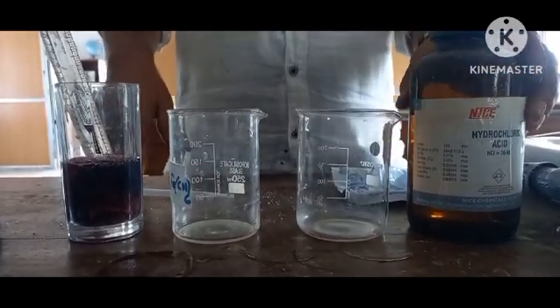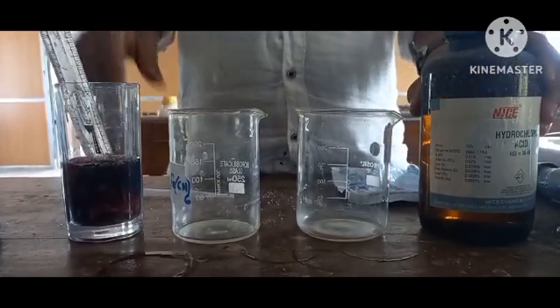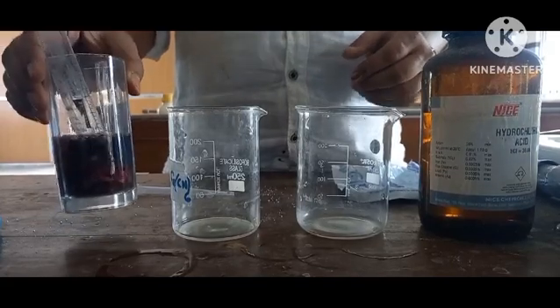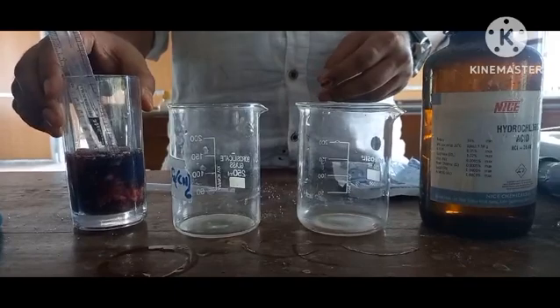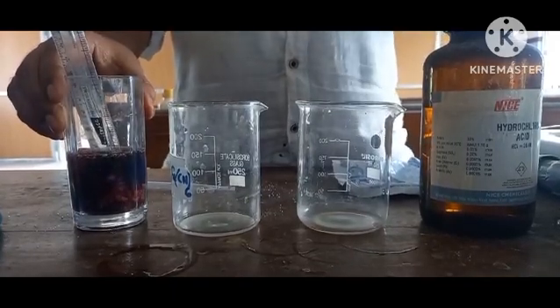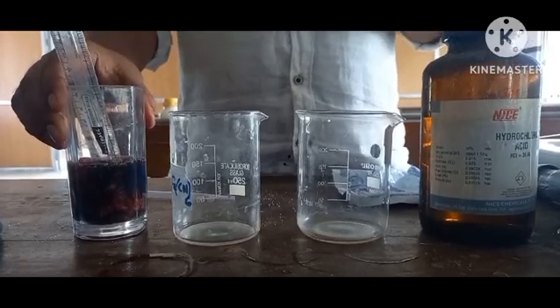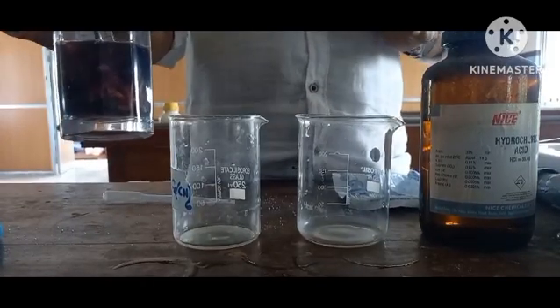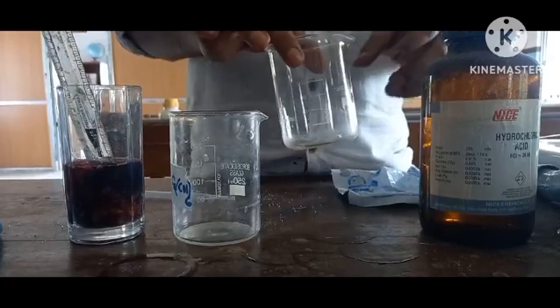So we are going to start with hydrochloric acid, which is lab based, and for the indicator we have taken China rose. We have prepared this China rose by soaking it in warm water. Just pluck two China rose flowers and soak them into lukewarm water for 3 or 4 minutes, and your solution is ready. At first we are going to prepare our acid solution in this beaker.